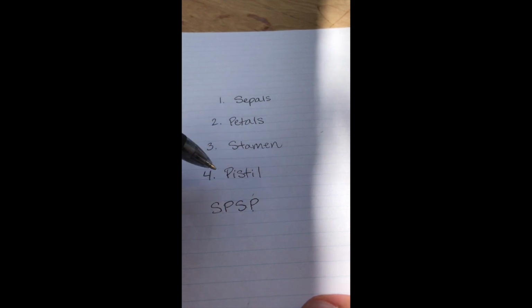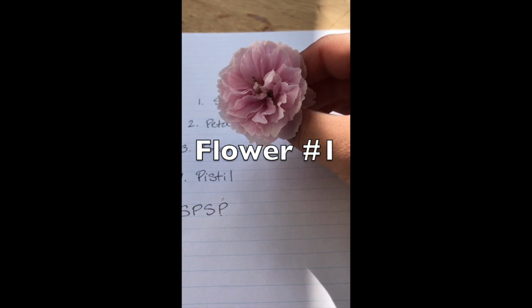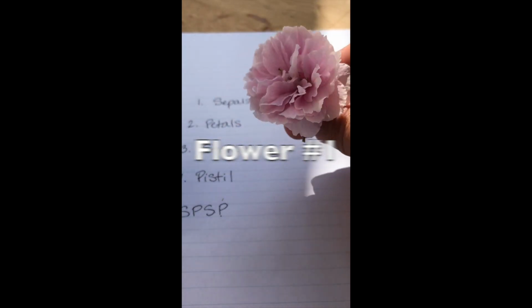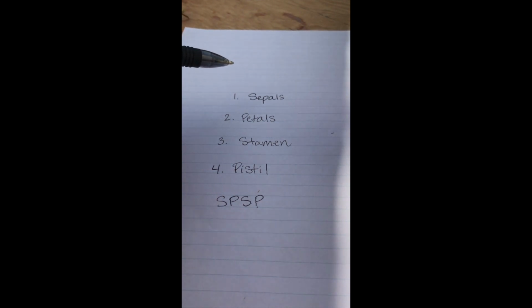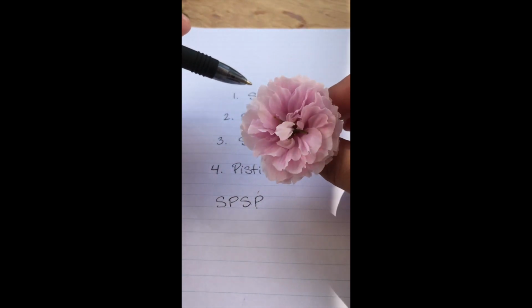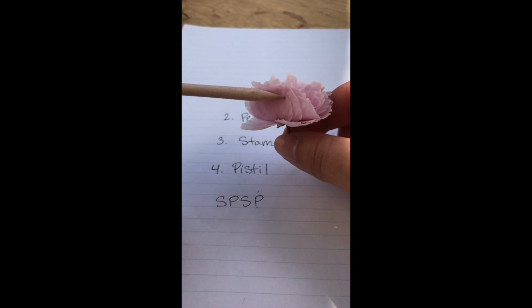But these are the 4 things you're going to be looking for in your dissection, and so I want to make sure that we're keeping those in mind as we're looking. So I'm going to start with one of these little flower blossoms that came from a tree in my neighborhood. So the first flower part that you're looking for is sepals. And the reading's going to talk about sepals and all of these flower parts a little bit more. But sepals are basically like the petals outside of the real petals. So you have the petals of the flower, but then sepals sort of hug those petals and give them more protection. So when you're looking at a flower like this, the petals are usually more easily recognizable because that's the word that you've heard of before.